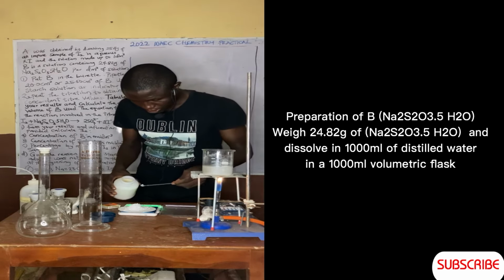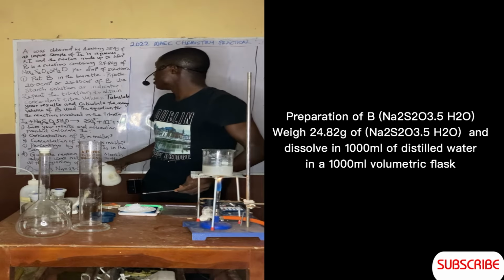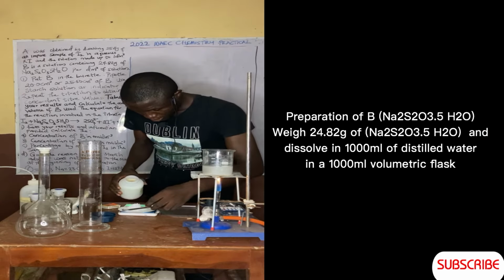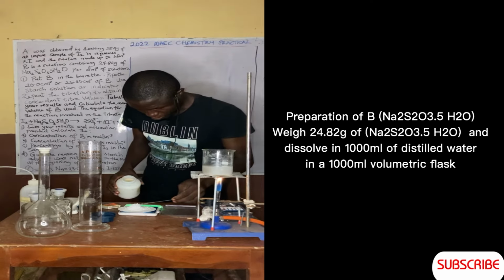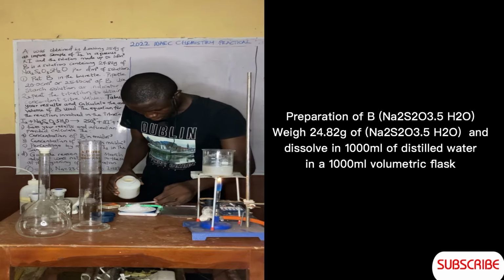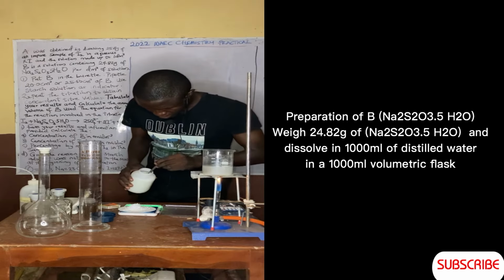So let's reduce it. This one is 24.84. So let's reduce just a little to 24.82. This one is 24.8, so let's just add a little.